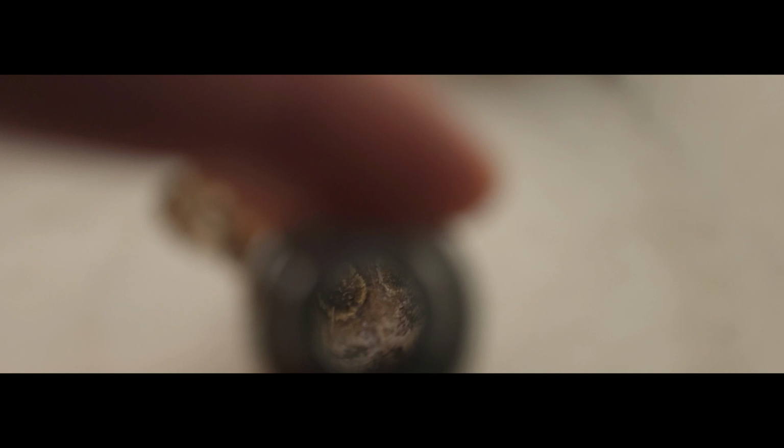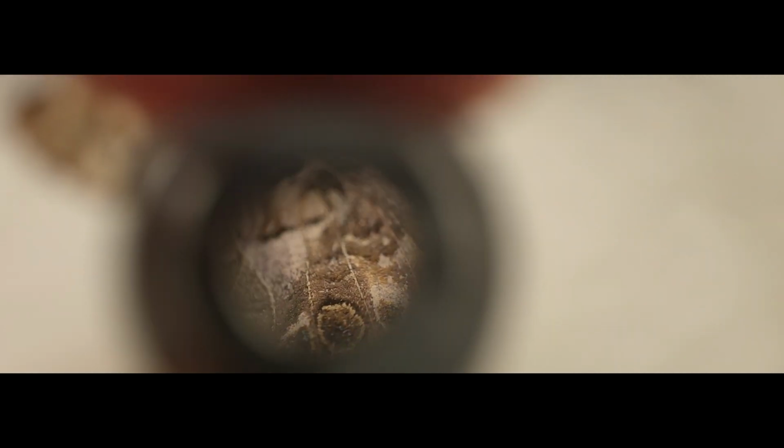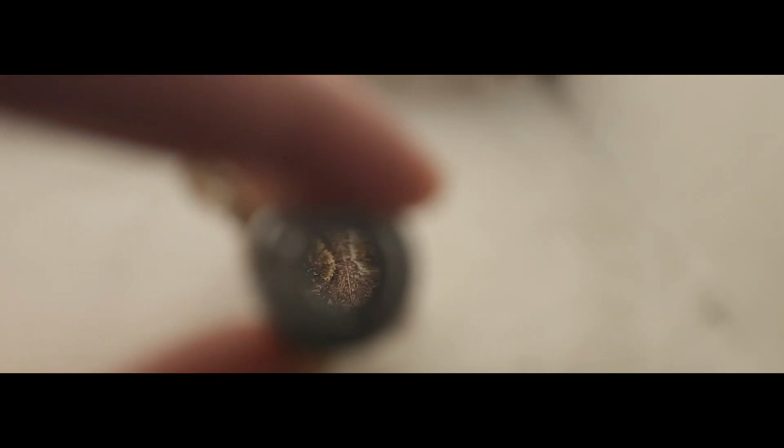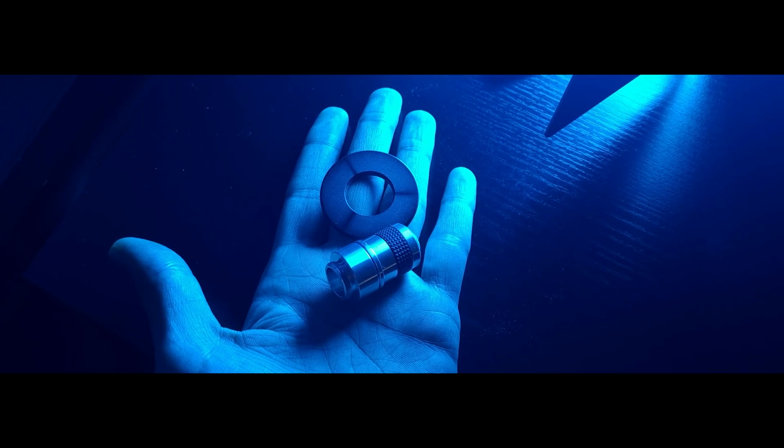Basically, when you put a distance between your lens and your camera, you'll increase the magnification. And when you decrease the distance, you will have a wider look and less magnification. By using this logic, you can easily adjust your magnification level without changing your lens all the time.